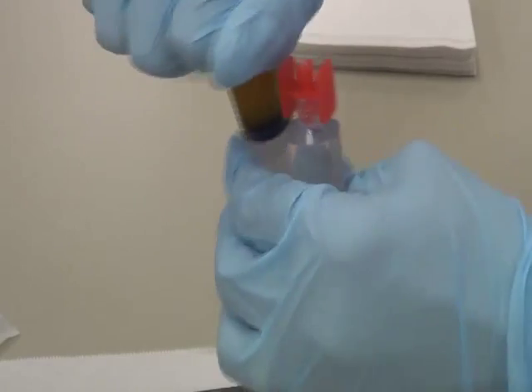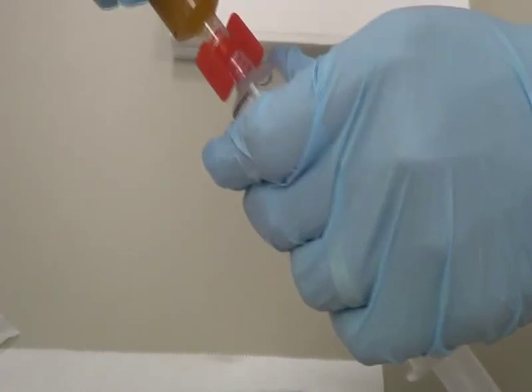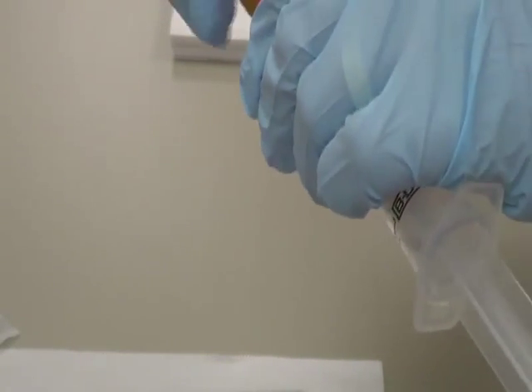And carefully open the other Luer tip and connect this with Luer lock. This is how you are connecting. So these are the two syringes that you connected back to back.